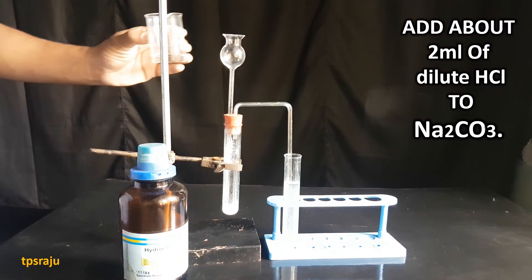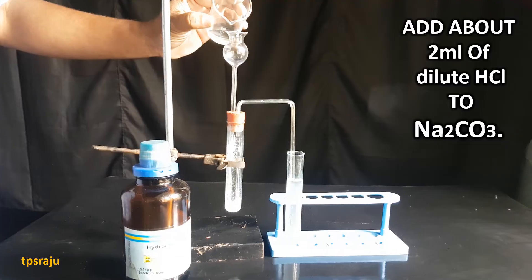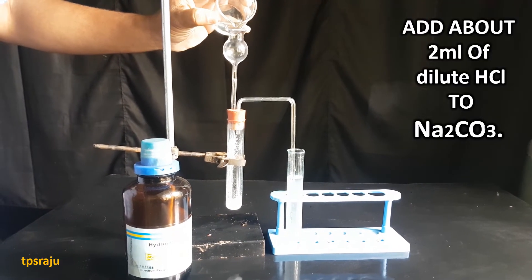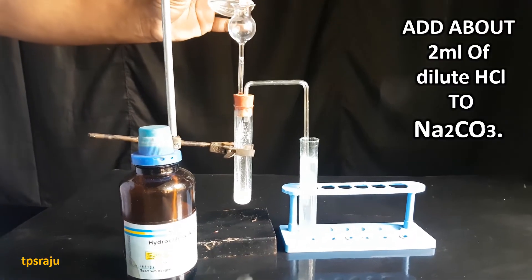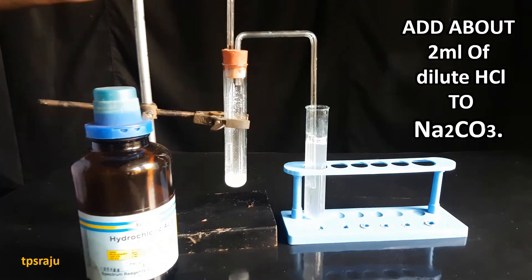Now we are adding about two ml of dilute HCl to the sodium carbonate. Observe carefully what is happening here.